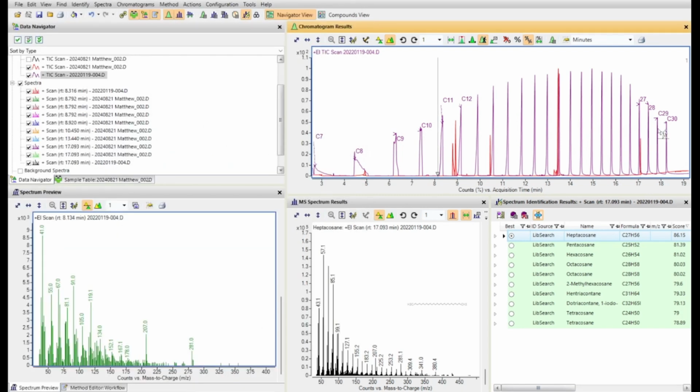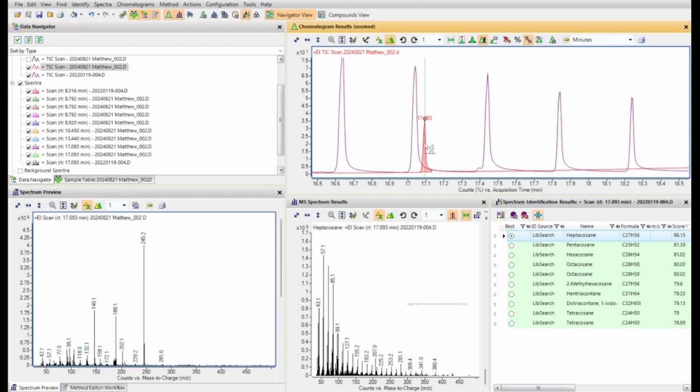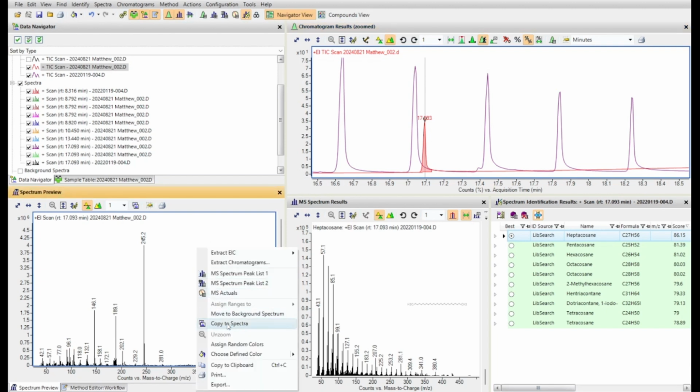If I follow this logic backwards from the end, and I want to identify this peak in red, well, I know that triacontane, C30, has a retention index of 3000, 29, 2900, 2800, 2700. So whatever the correct answer ends up being for this small red peak should have slightly higher than a 2700 retention index. Let's go ahead and identify it and then check with NIST.